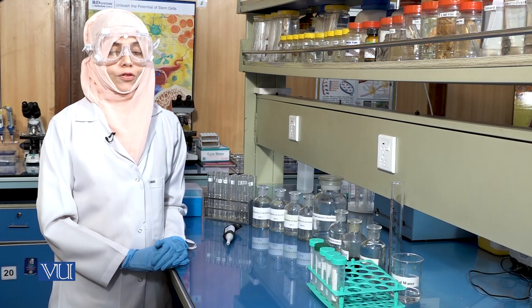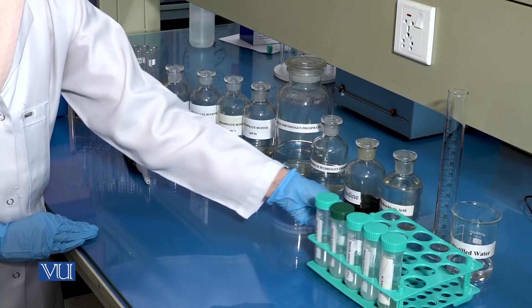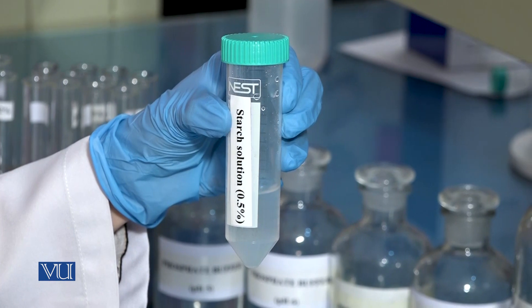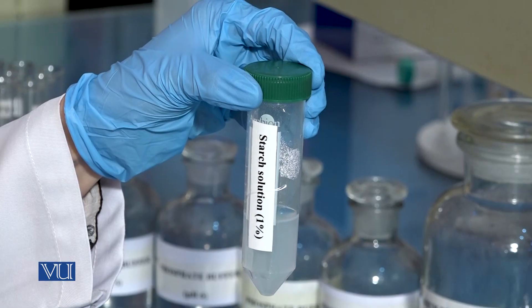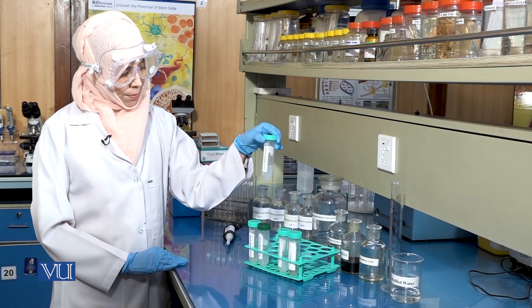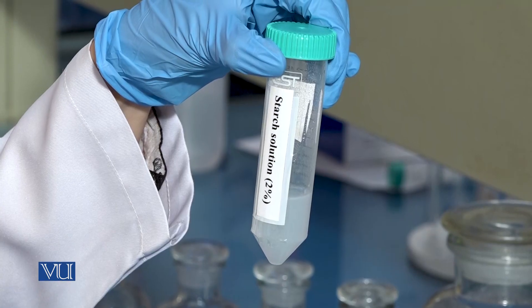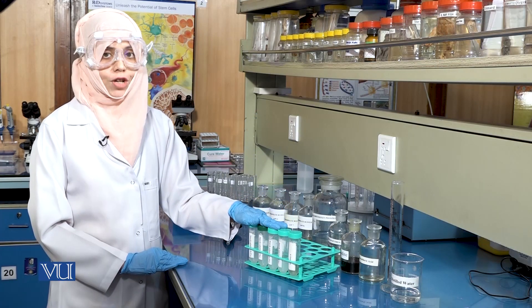To check the effect of substrate concentration on the activity of alpha amylase, we will prepare four different starch solutions of different concentrations: 0.5 percent, 1 percent, 1.5 percent and 2 percent. All four solutions have been prepared using phosphate buffer of pH 7.